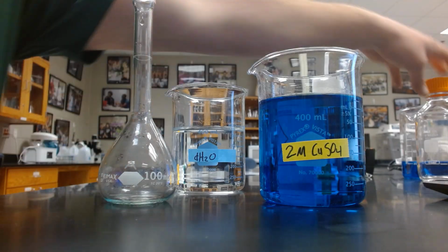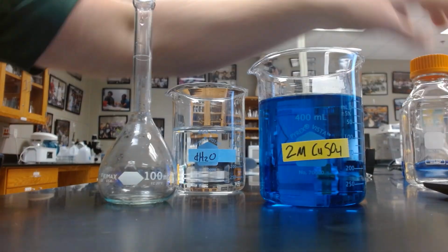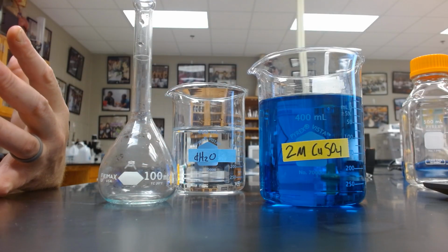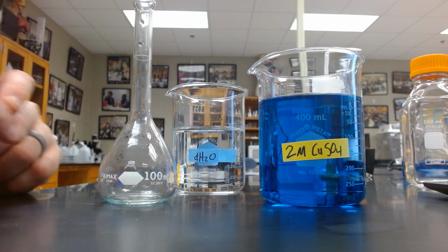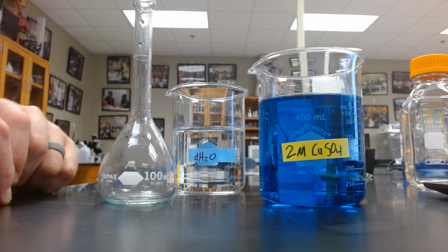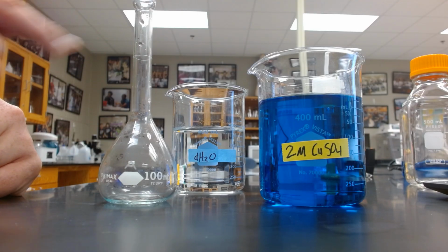This is more accurate than a bottle such as this. It's more accurate than a beaker. It's more accurate than a flask. It's even more accurate than a graduated cylinder. Because those are, for one, larger, so it's harder to be as accurate, and they have several graduation marks. This is designed only to measure 100 milliliters. So every bit of technology, every bit of manufacturing that went into designing this is all about that one line.